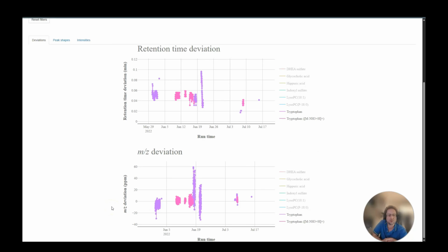In positive mode, it starts out okay, being plus minus 10 ppm apart from the offset. If we again start by the first batch here, we can see that it is systematically offset. So that indicates a calibration issue.